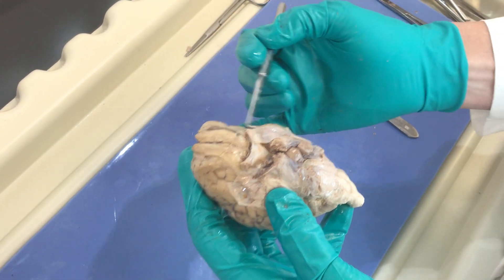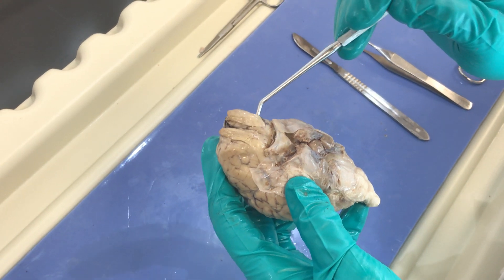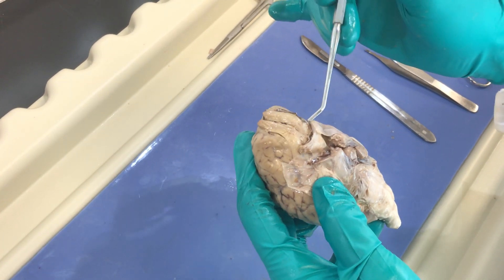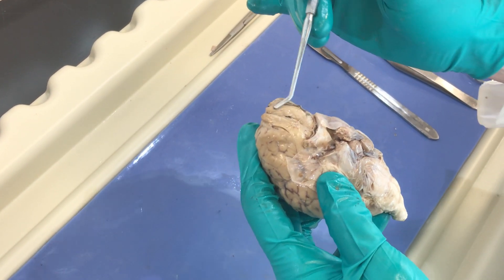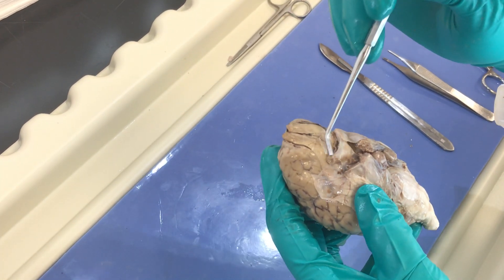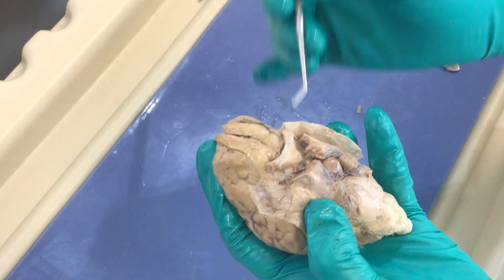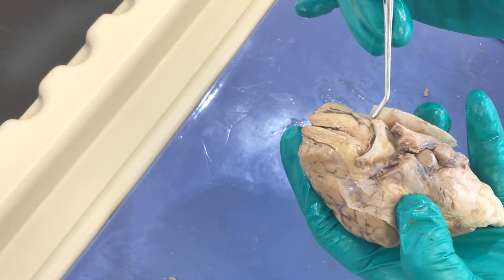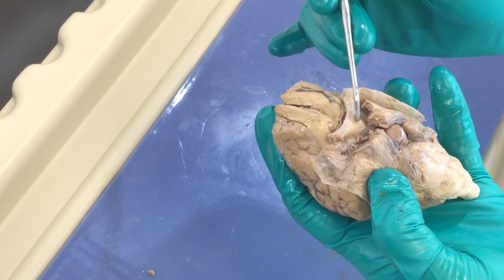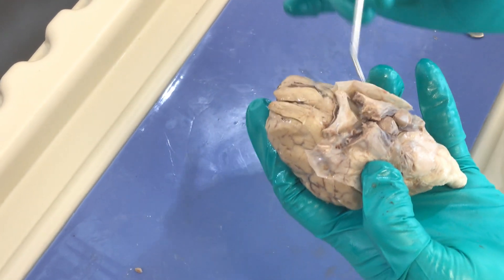We can see the temporal lobes to either side here. We have some cranial nerve structures — the actual cranial nerve extends into these olfactory bulbs here. These are the olfactory bulbs, and these represent the olfactory tract to the brain for the sense of smell. Additionally, we can see the optic chiasma, where the optic nerve is coming in. It's been transected here, and some of the fibers will cross and some will stay on the same side, giving us a little X shape.